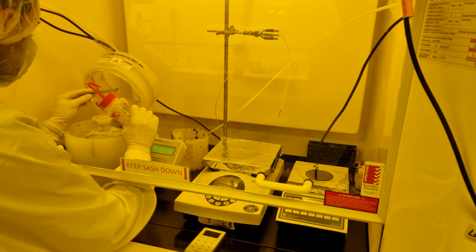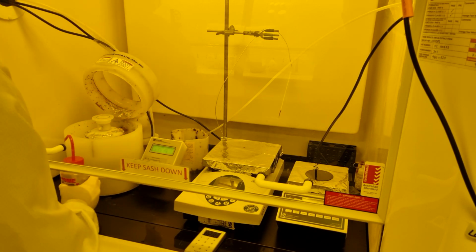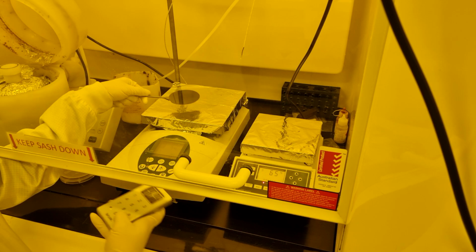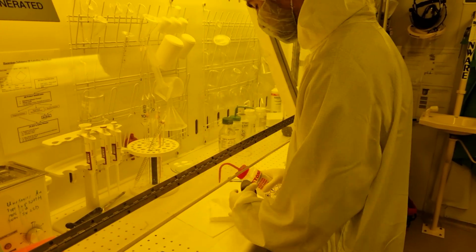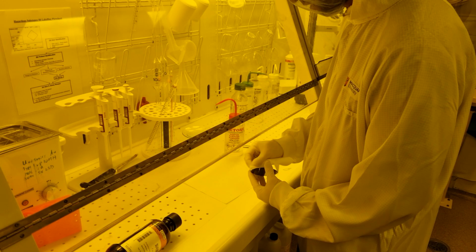Run the spinner while squirting acetone onto the spinning substrate. Make sure the solvent waste reservoir behind the spinner does not overflow. After the soft bake, the resist layer is likely to be soft, but should not leave residue on your tweezers. As with the first layer, thick resist can get onto the back of the wafer. If this happens, the back must be cleaned by hand using acetone and a cleanroom wipe.